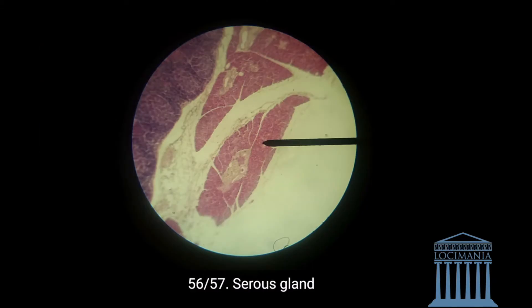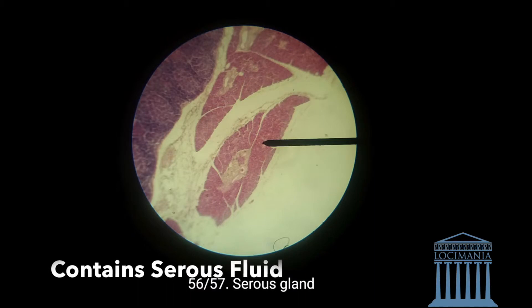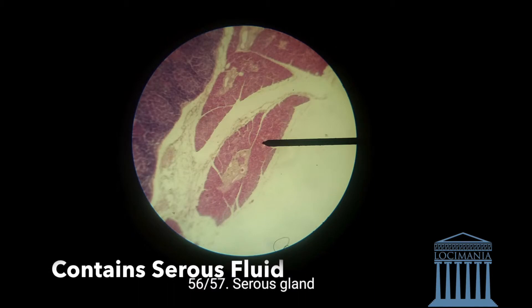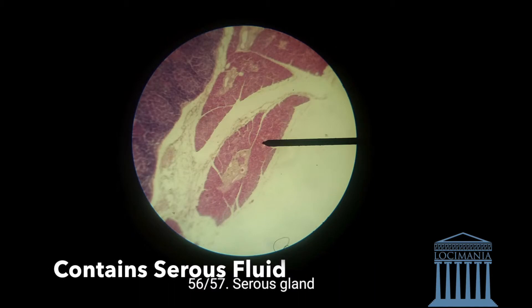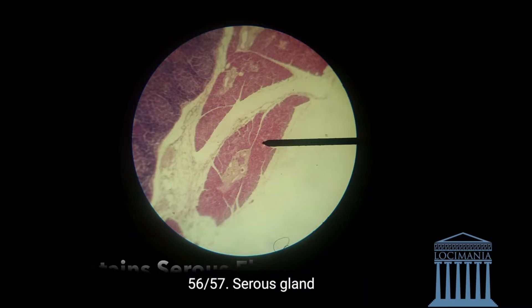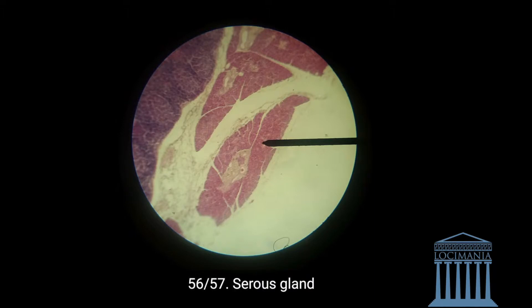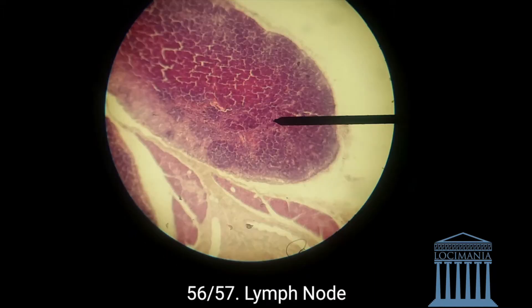Going on to the details directly, here we have the serous gland. As you can see, the serous gland is kind of dense with something in the middle — we'll discuss that a little bit further. So the serous gland is this one.